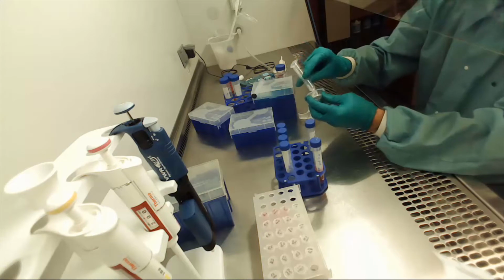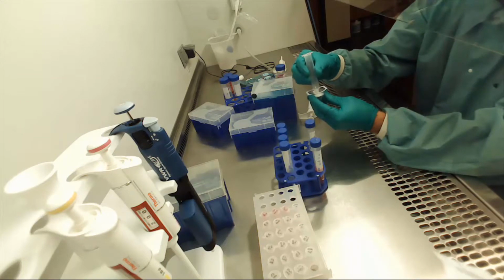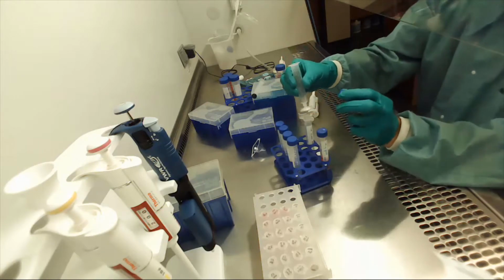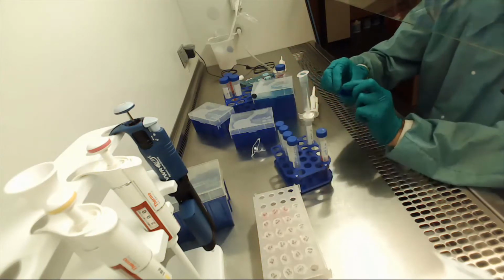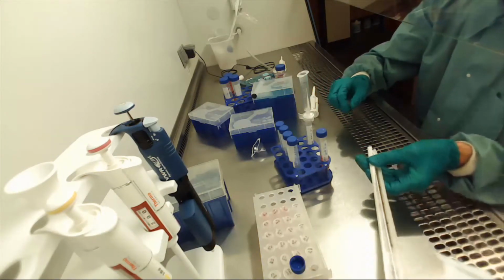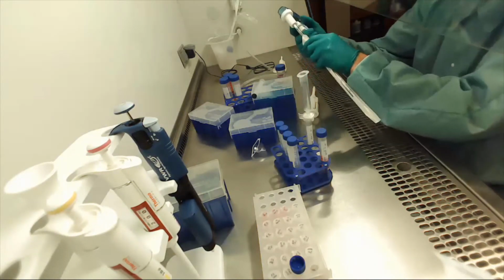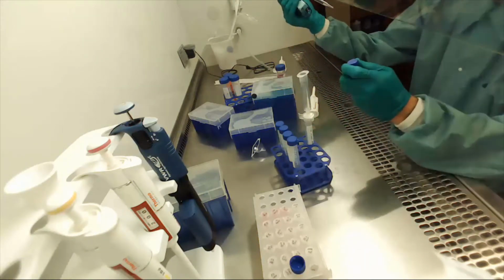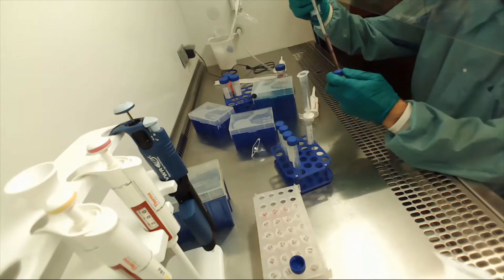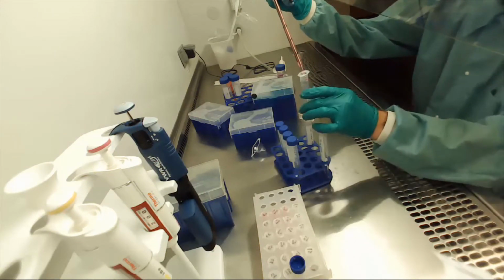And so what I'm going to do is go ahead and get this on here like that. Okay, and so again, I'm protecting that output as much as possible. And here's my tube I'm going to leave sterile. And I'm actually just going to try to balance that. I'm going to do my best to keep that cap sterile as possible. Okay? And we are going to go ahead and sterilize this liquid. We will lose a little bit of liquid in the sterile filter, which is why I made more than 5 mils. If I made exactly 5 mils, that would have been a problem.